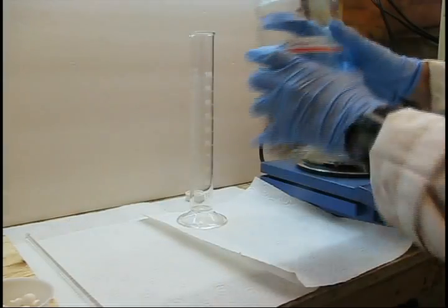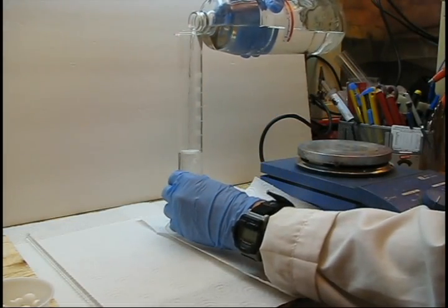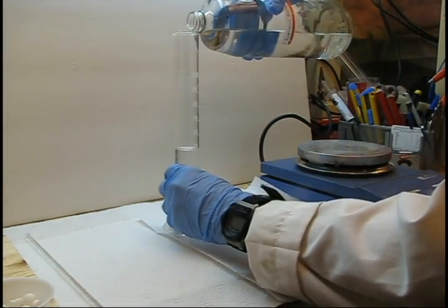Begin by measuring out 1 milliliter of isopropanol for each tablet of aspirin. I am measuring out 50 milliliters of isopropanol to 50 tablets of aspirin.